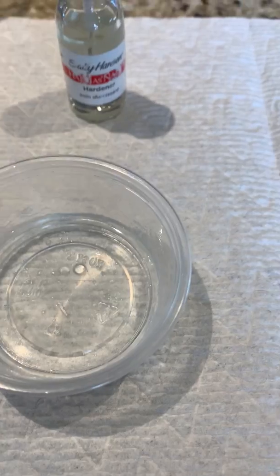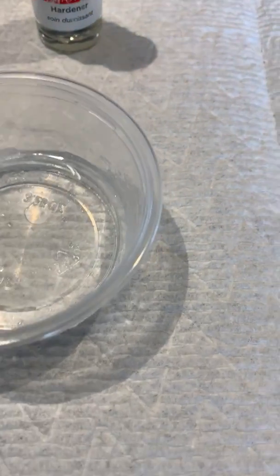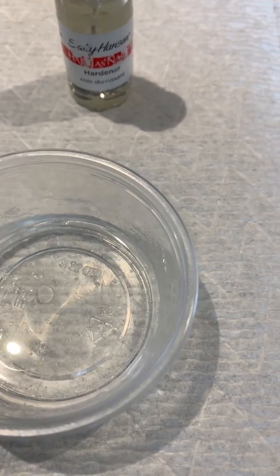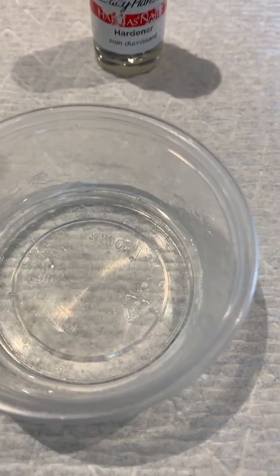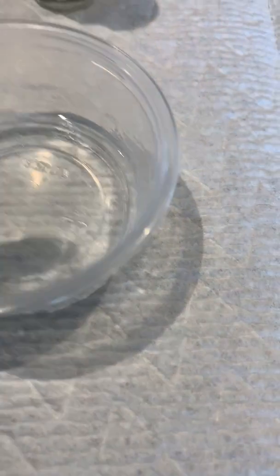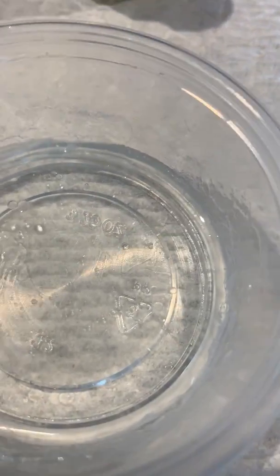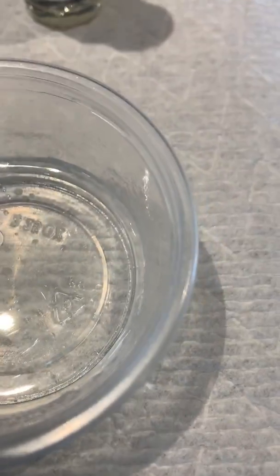Although, in the presence of the non-aqueous solvents, that can lead to some deposition on the sides of the container, and it could lead to some bubbling as well.